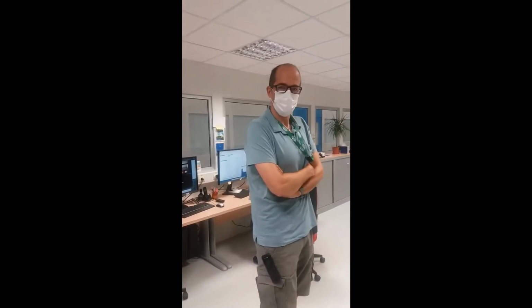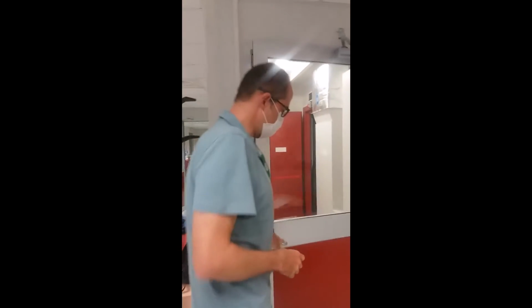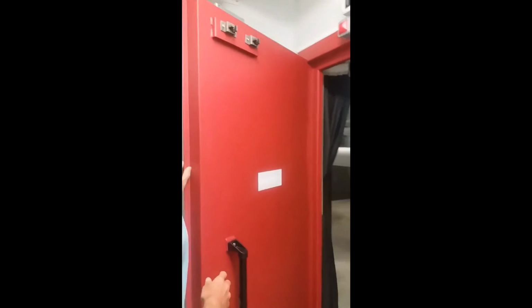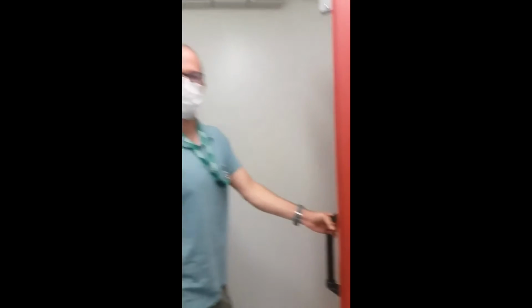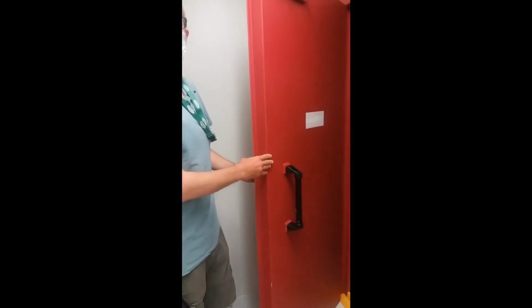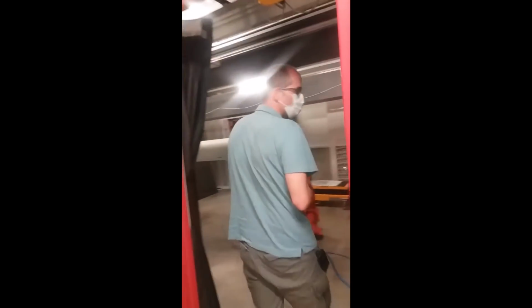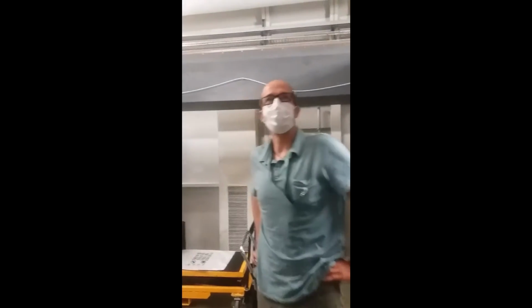So how we typically do it, we can go in, we're at the beamline. So here we're stepping in. Now, because it's a high energy beamline, we have these very thick lead doors, which are very heavy. I have to use like two hands to stop it when it goes. Right, and that's because the radiation is high energy, so it's penetrating. That means we have to have quite a thick lead wall, so it does not irradiate us during the experiment. So here we step into the beamline, into the experimental hatch.